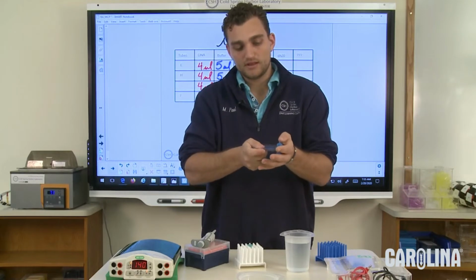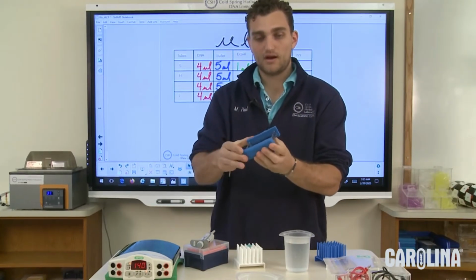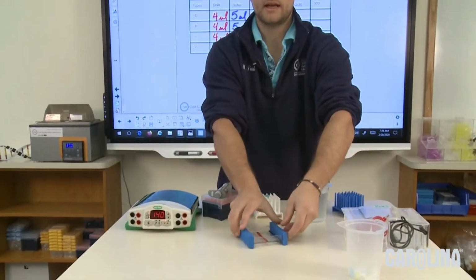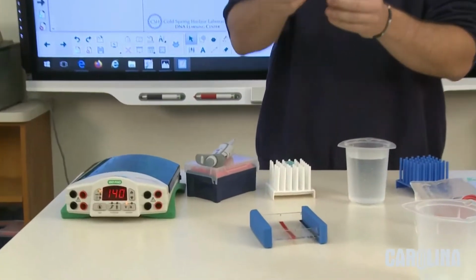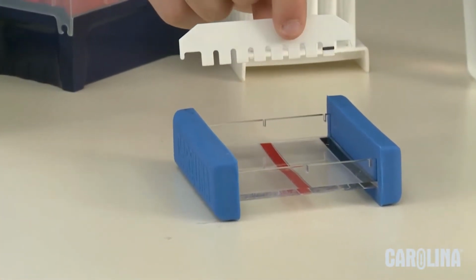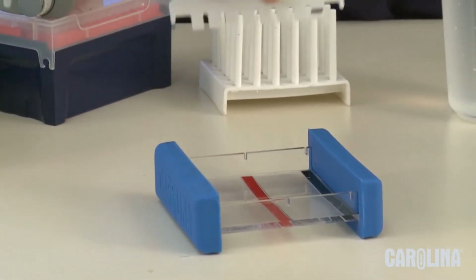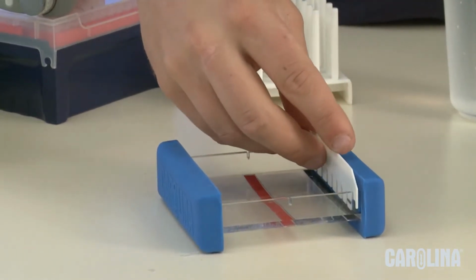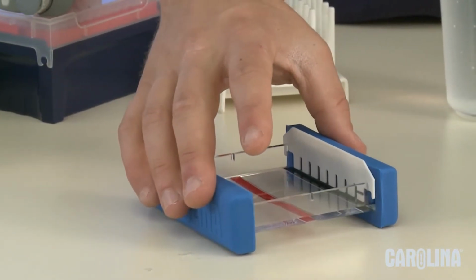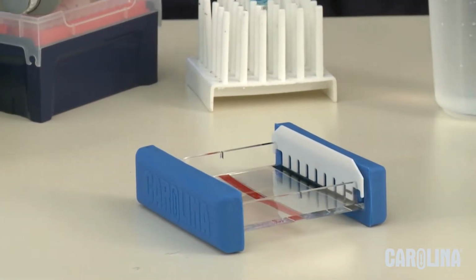I'm going to put this stopper on there, right there, and then I'm going to put that down. Now, I'll take my comb, because eventually I'm going to need to put the DNA in there, and for that I have to have this comb. So I'm going to put that comb in on these black notches right here. You'll notice the comb has a little black line on it. That black line is going to tell me where I need to pour to, okay?